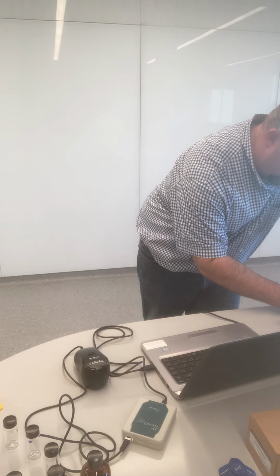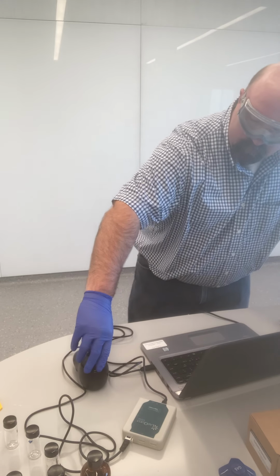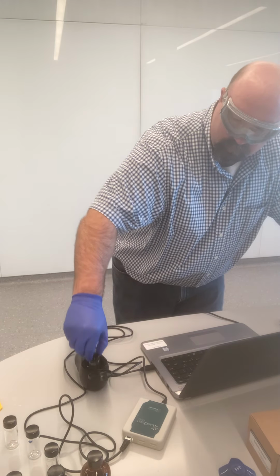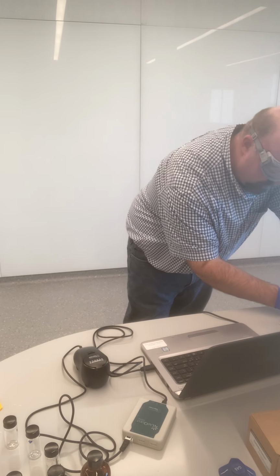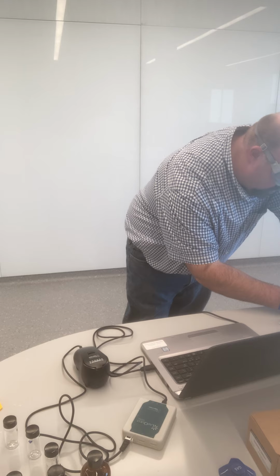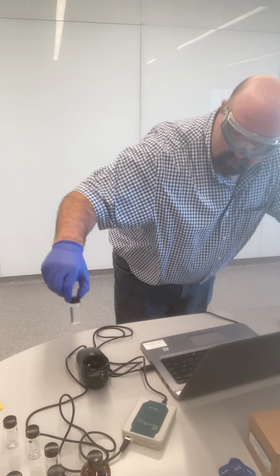And we get a measurement of 27.6 NTUs. 28.9.